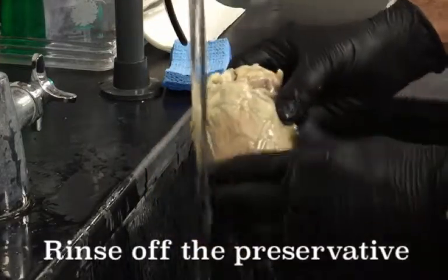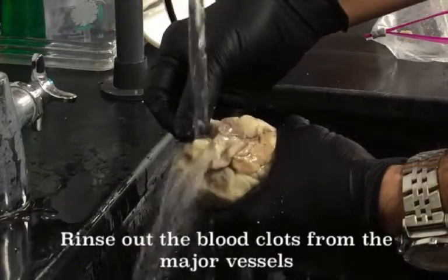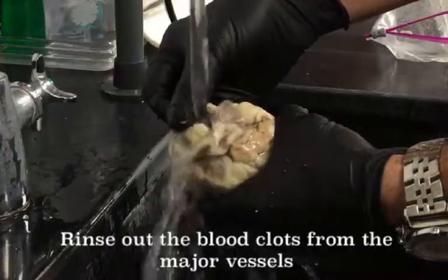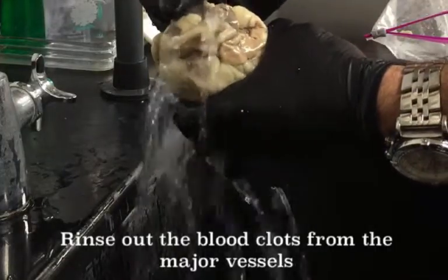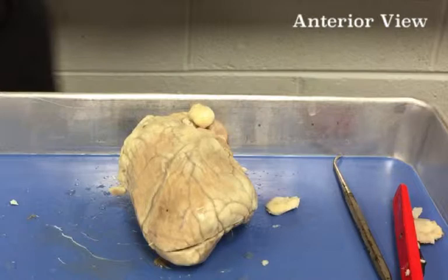Rinse your heart in water thoroughly to remove as much of the preservative as possible. Also, if you can, run water into the large blood vessels to force any blood clots out of the heart chambers. Place the heart in a dissecting tray with its anterior surface up, as shown.